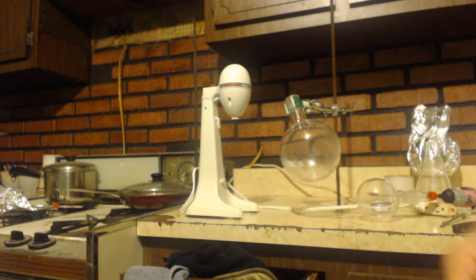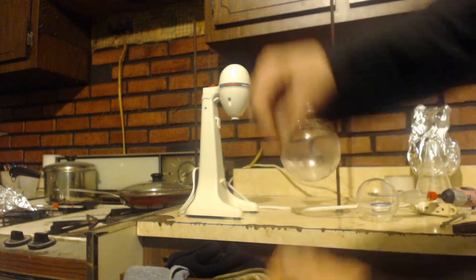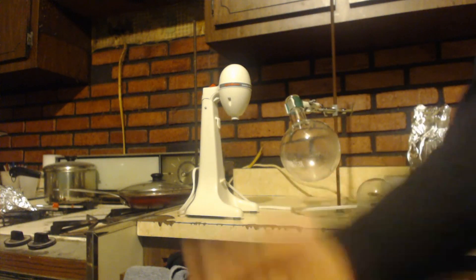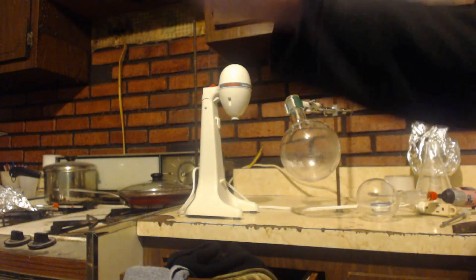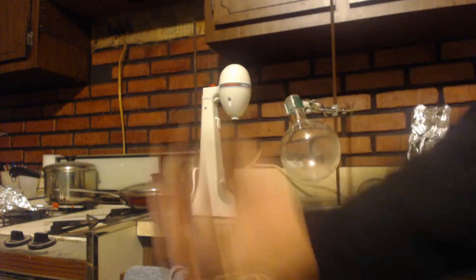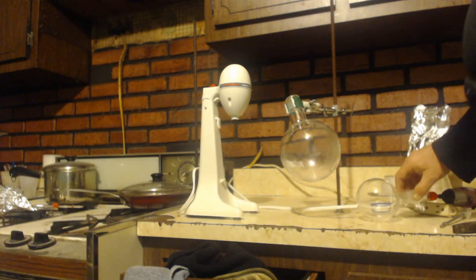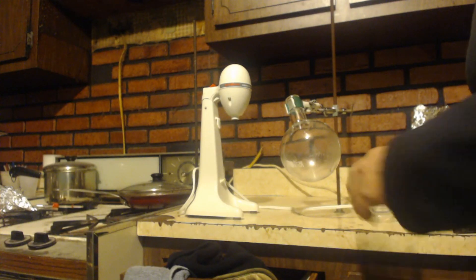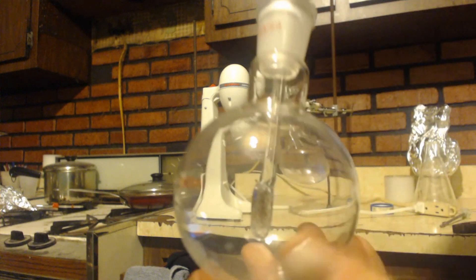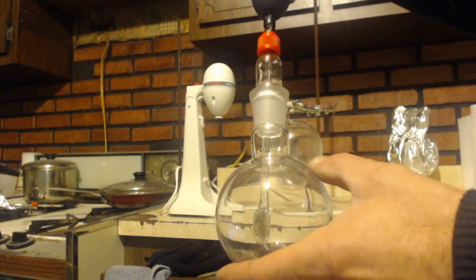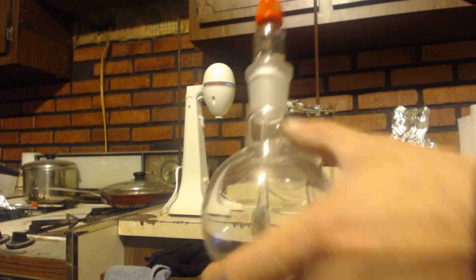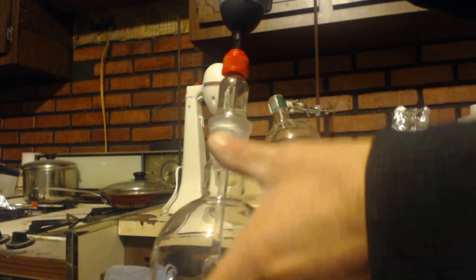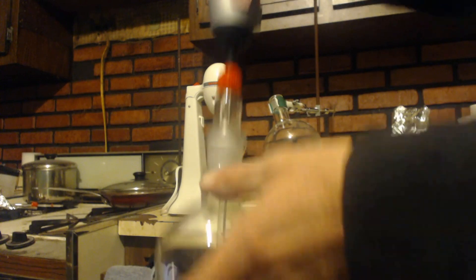That way as it refluxes, the condenser will condense it out and you won't need a gasket on your stir rod. You can basically just think of this part right here as the condenser, just enlarge it.